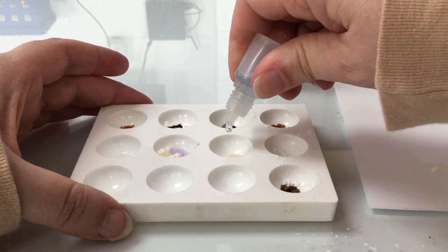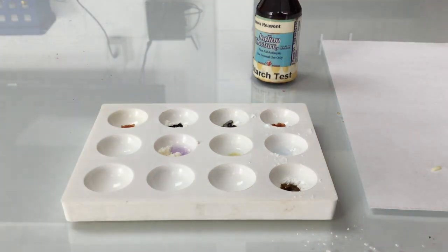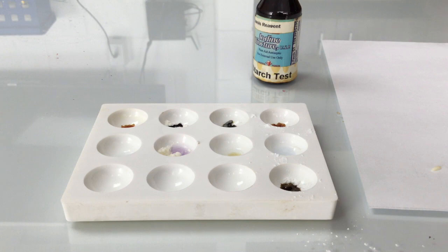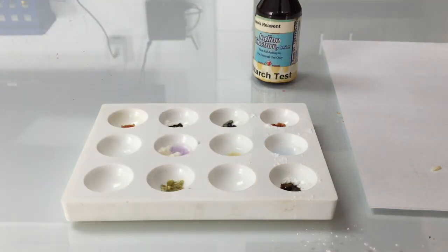Now we will test the rice and the powdered sugar for protein. Remember, this takes a while to react, so we'll come back and look at it later. In the meantime, we will look at another food, pumpkin seeds. Now remember that seeds are going to have all of the nutrients needed for a plant to grow. So we're going to test it for all of the different nutrients here. We'll use 2 spots in the tray to test for the protein and for the starch. And then we will also put some on the paper and see if there's any fat in it.